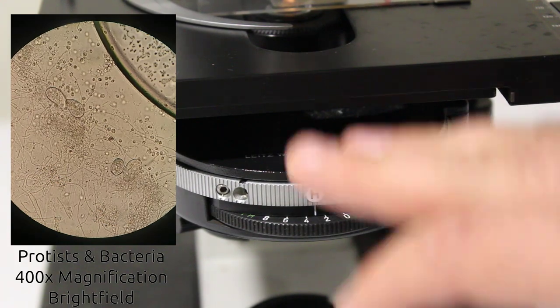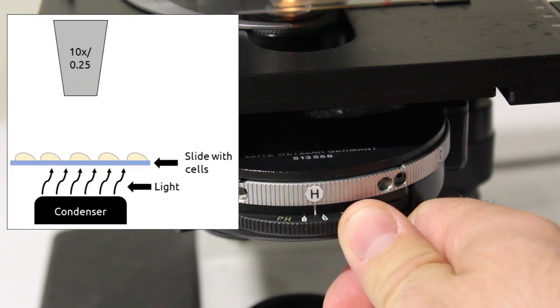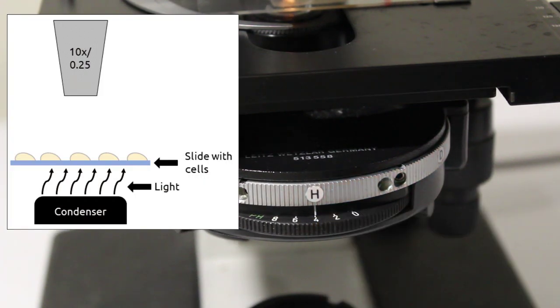What this setting does is it ensures a nice even illumination of the focal plane and you can make some adjustments using this little wheel down here to help enhance contrast or bring out more color.